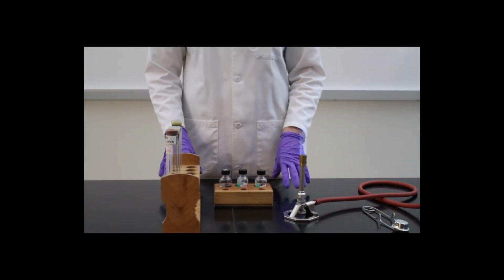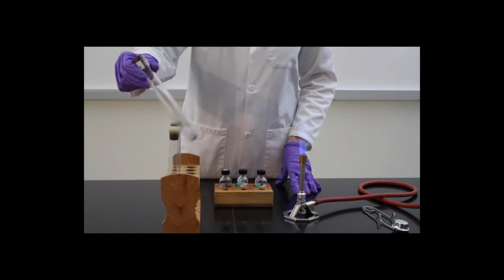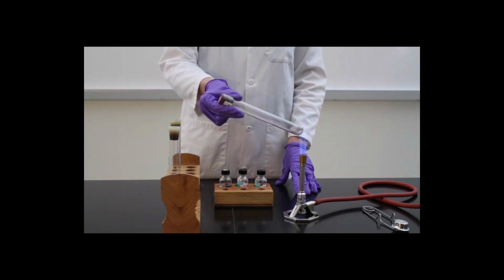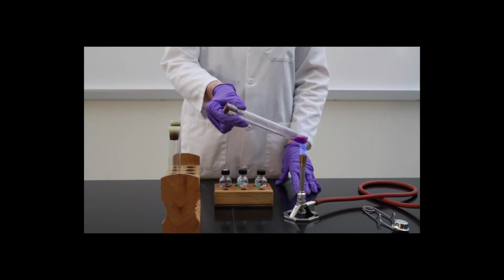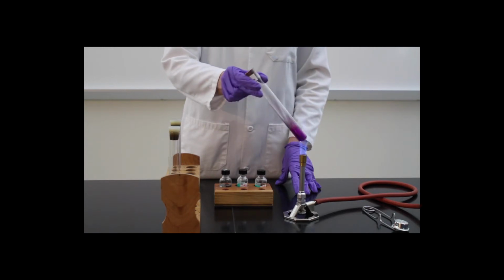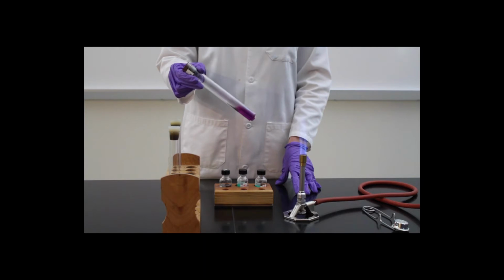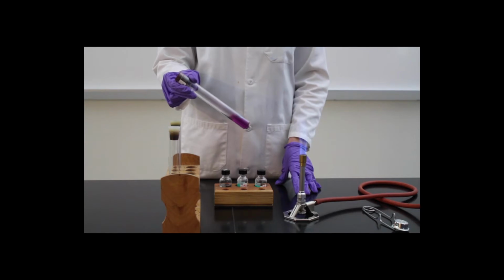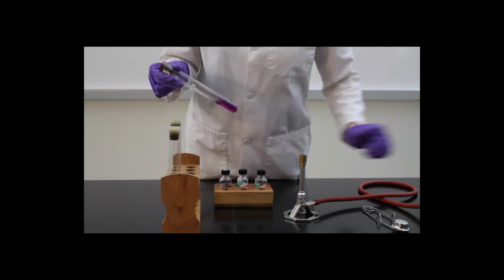This demonstration illustrates differences in solubility and intermolecular forces. So I'm going to take a test tube, and this test tube contains solid iodine, and we're going to heat up the iodine, and we're doing that to show the color that iodine normally has. And what we can see is that the iodine is a deep purple color, and so this deep purple color illustrates the presence of iodine in our solutions that we're going to look at.